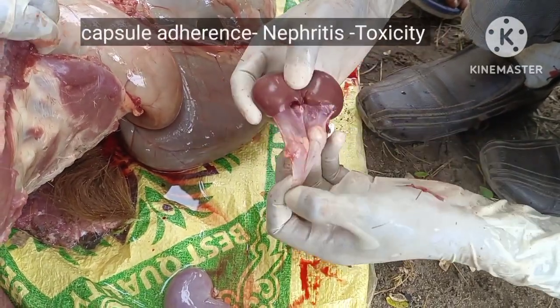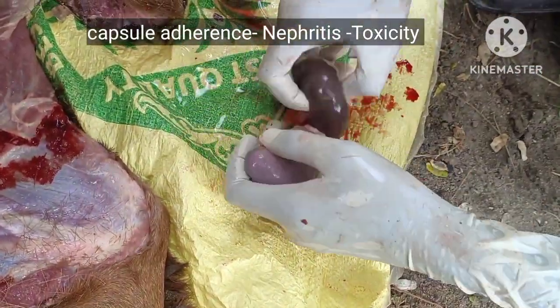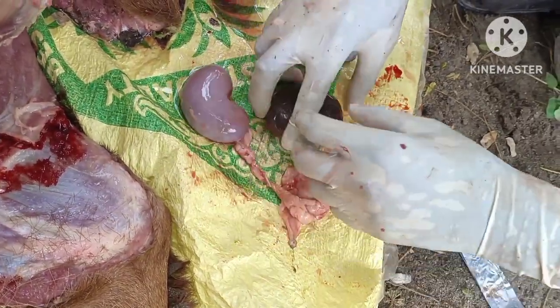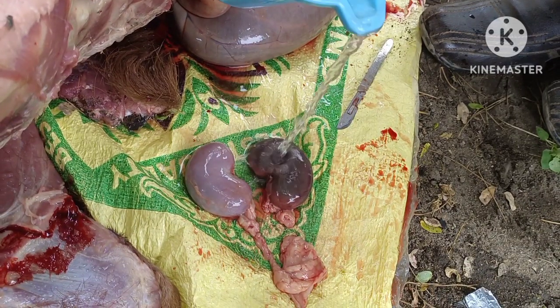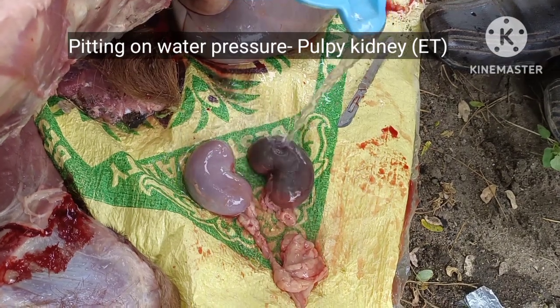After removing the capsule, place the kidney on the floor on the surface and try to pour water on the cortex of the kidney. And if it is a pulpy kidney disease, which we can see in the enterotoxemia cases, this water pressure also makes holes into the cortex.